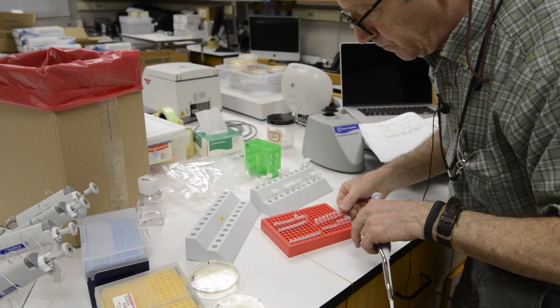Your instructor will then run those tubes in a PCR machine for 36 cycles as described in the protocol.